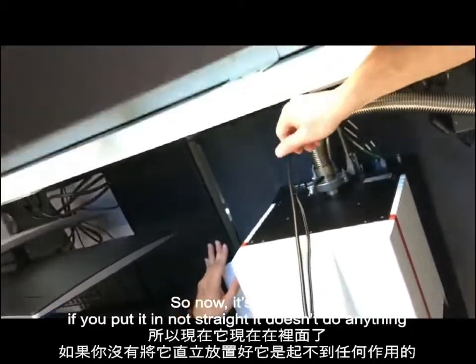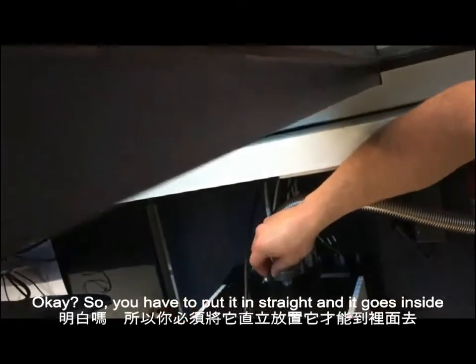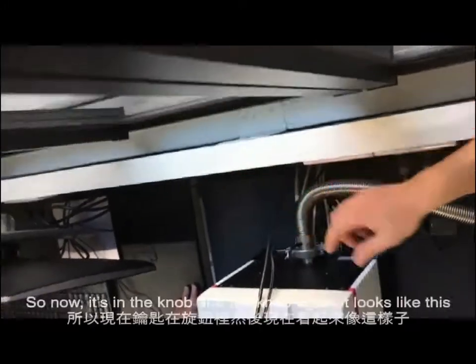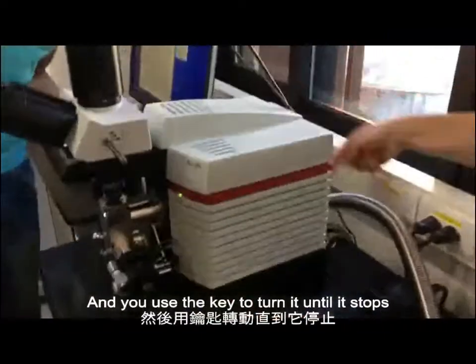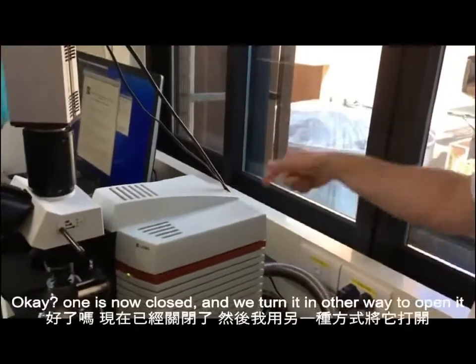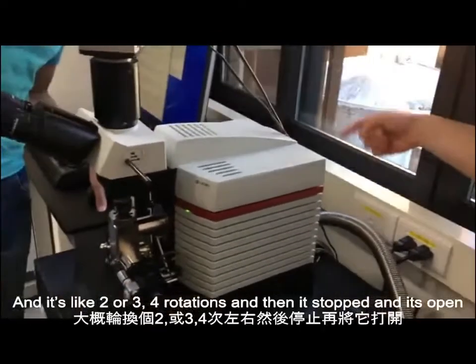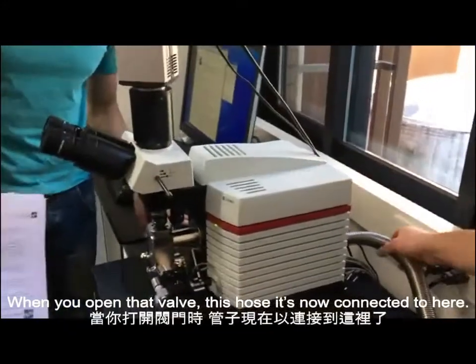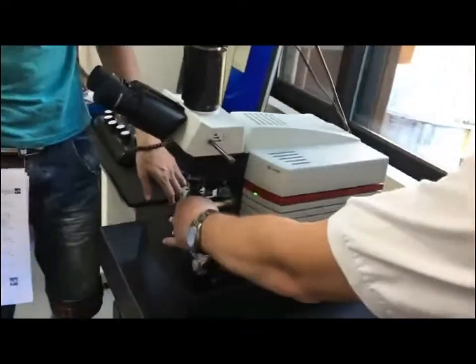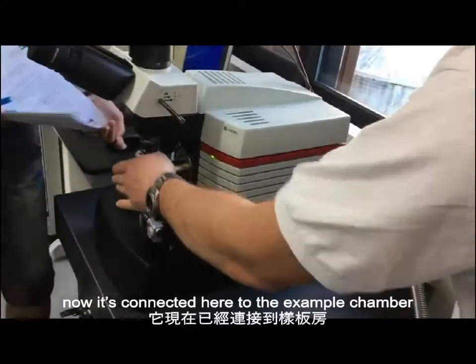Okay, so now it's inside. If you put it in not straight, it doesn't do anything. Okay, so you have to put it in straight, and it goes inside. So now it's in the nut, and the nut, again, it looks like this. And you use the key to turn it until it stops. Okay, it's now closed, and we'll turn it the other way to open it. And it's like 2 or 3 full rotations, and then it stops and it's open. Okay? When you open that valve, this hose is now connected to here. So normally it's only connected to here, right, to the airlock. Now it's connected here to the sample chamber.